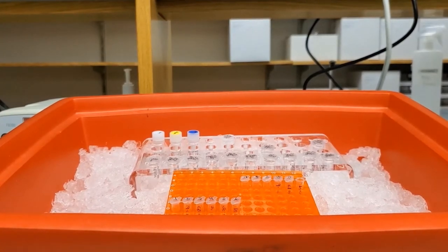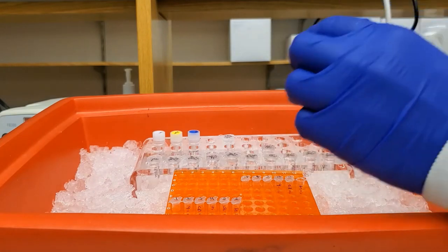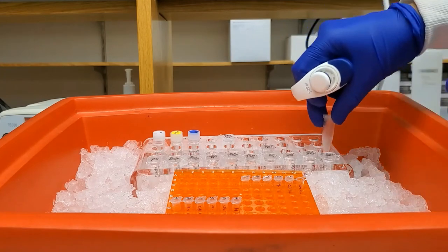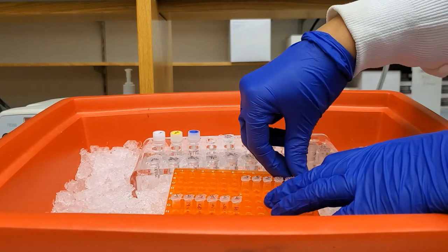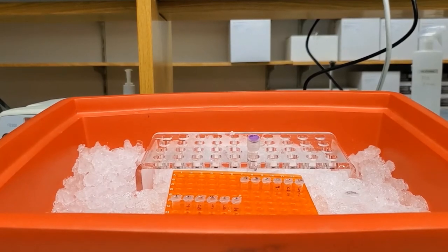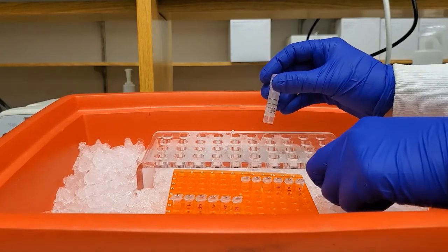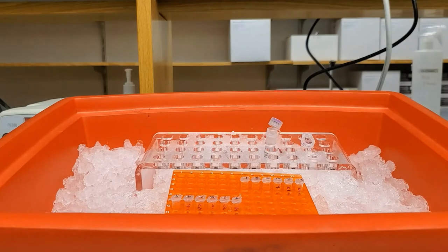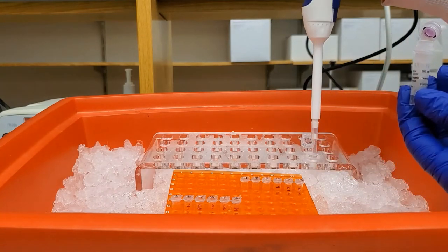Now that I've finished adding nuclease-free water, I start adding RNA — enough volume to make 500 nanograms, which will be synthesized into 500 nanograms of cDNA. For my first sample, my control, I use five microliters of RNA. I keep it on ice, mix gently up and down, confirm my volume, then mix gently into the water and close the tube. I'll be adding master mix to these tubes as well.